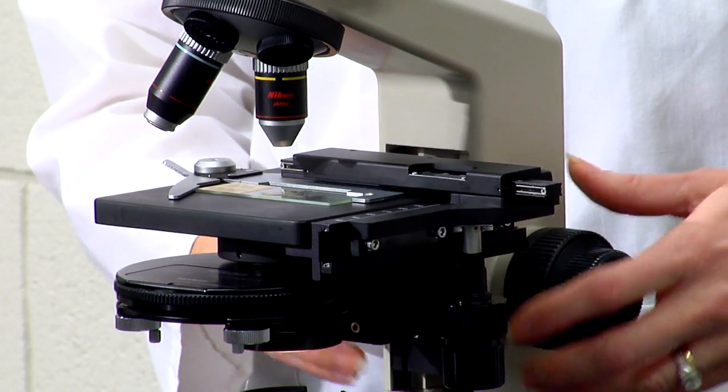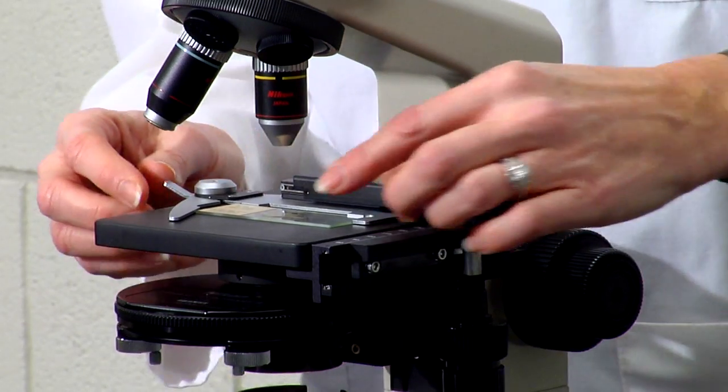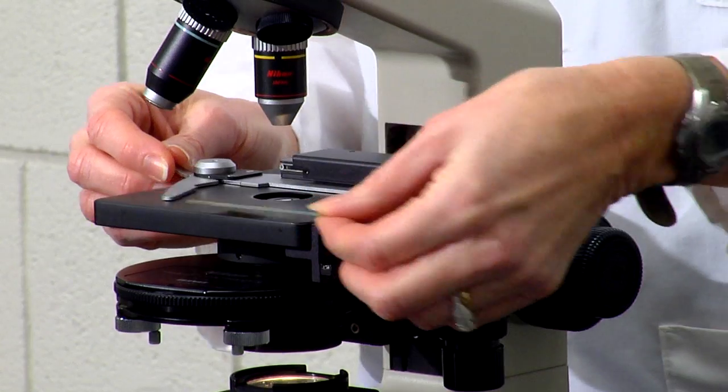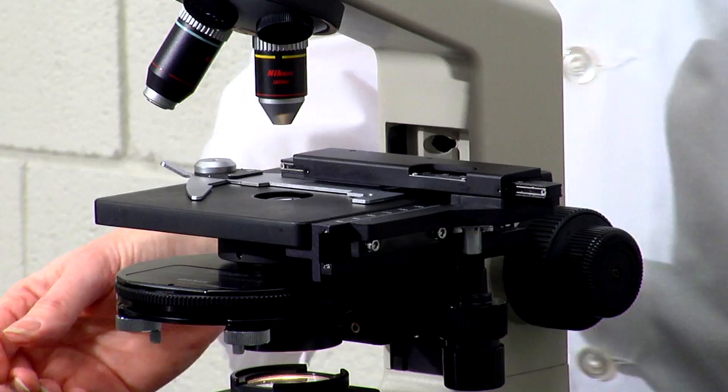When you are done, lower the stage using the coarse adjustment and remove the slide. If necessary, you can wipe off the stage with a Kim wipe.